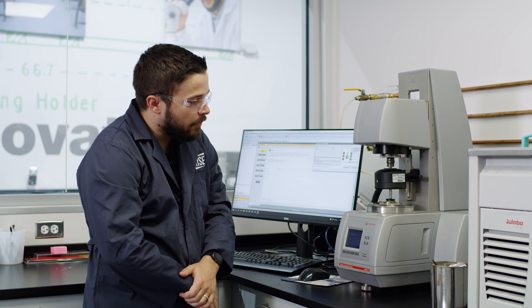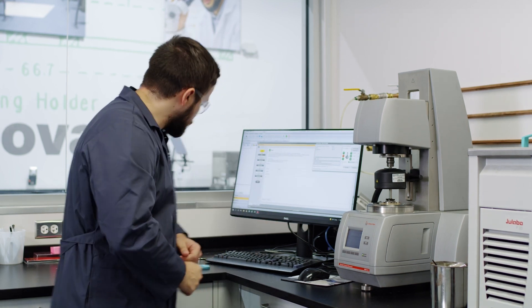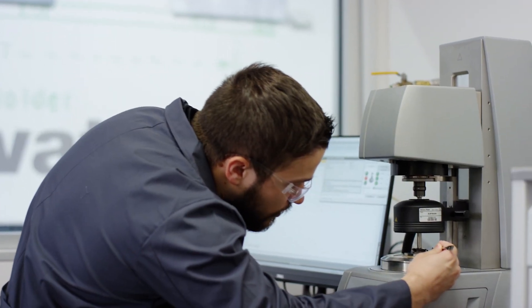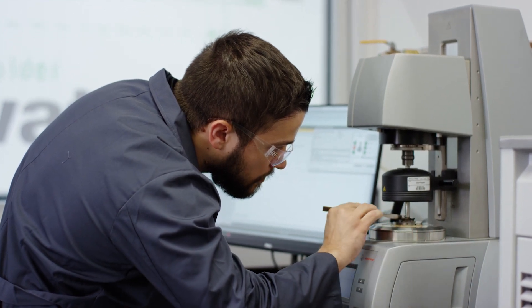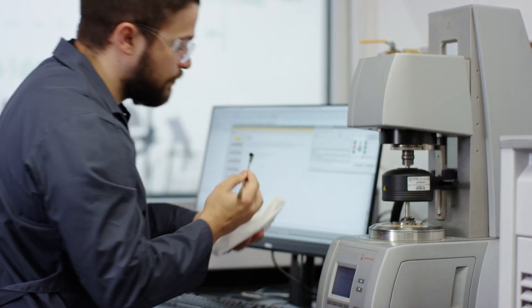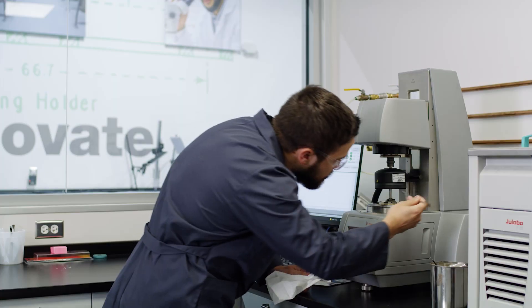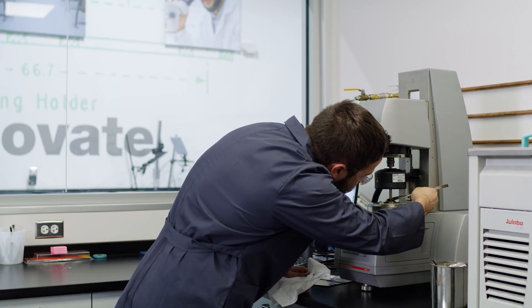Now that this has stopped, we'll trim off the excess. We just trim around the edge here. And pull—you can see the nice elasticity we get out of the blend there. Real good stuff.